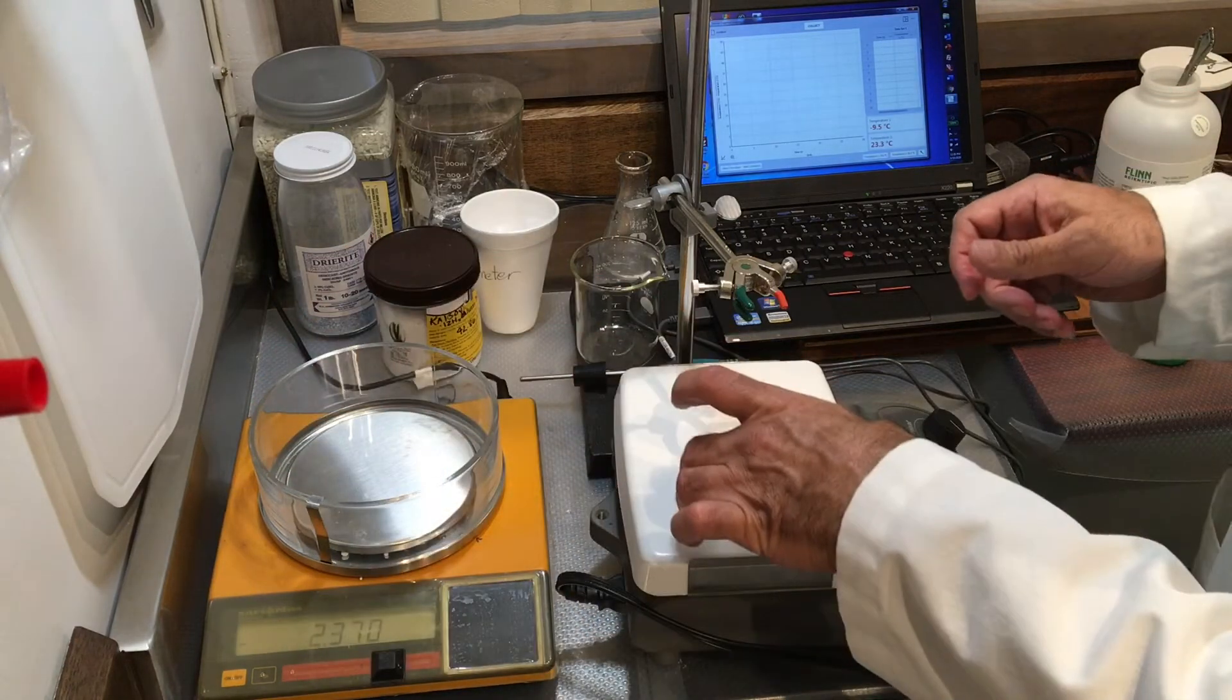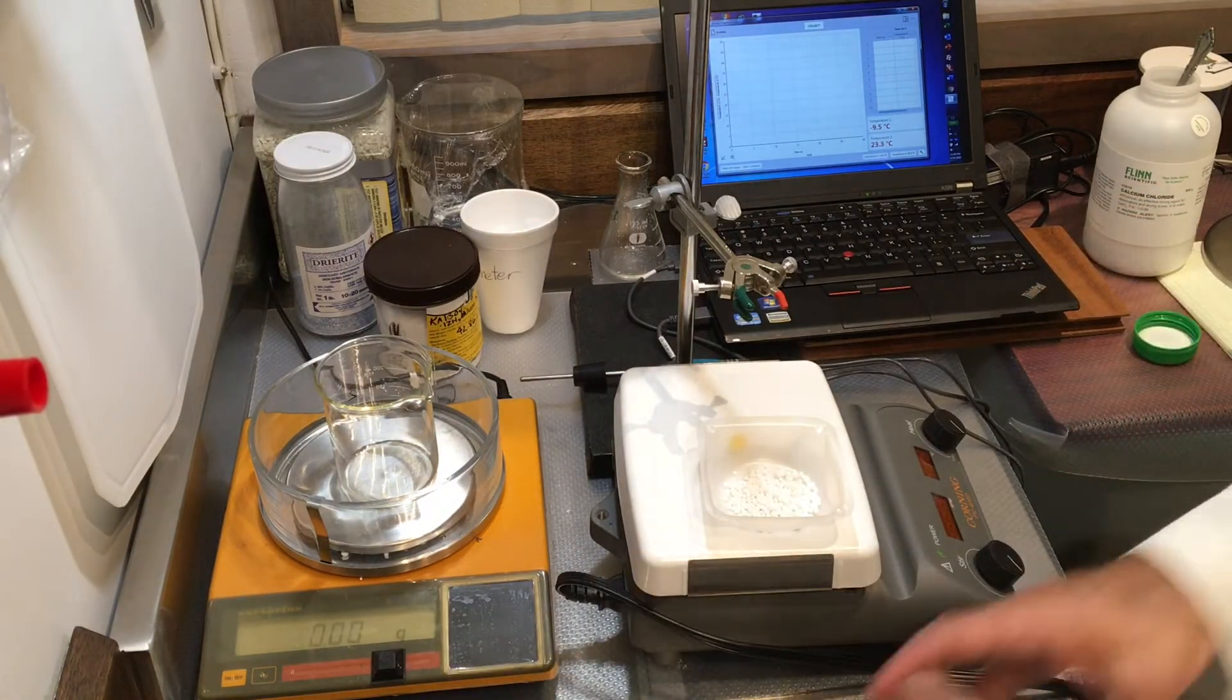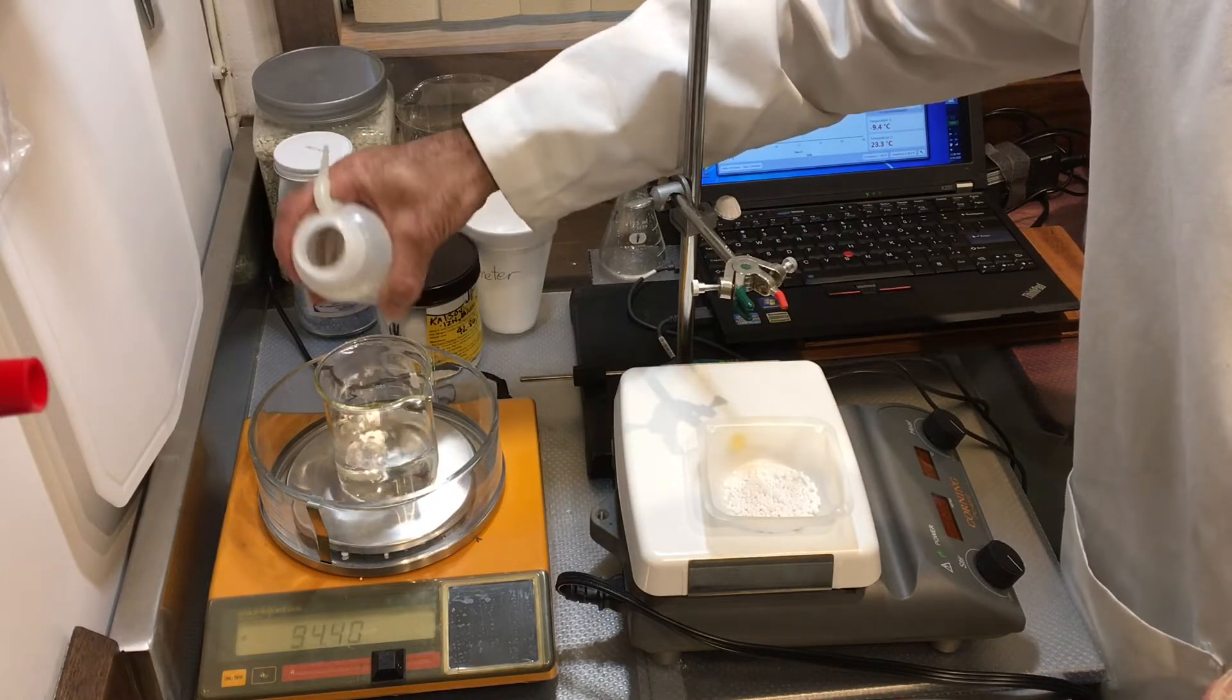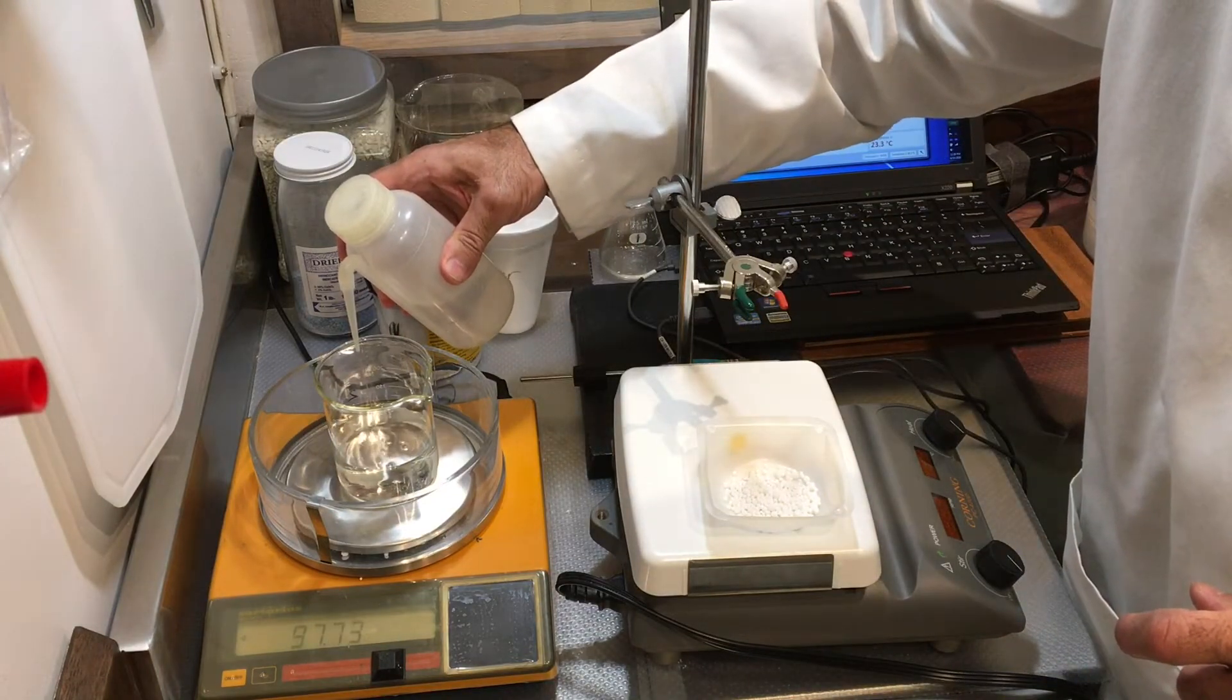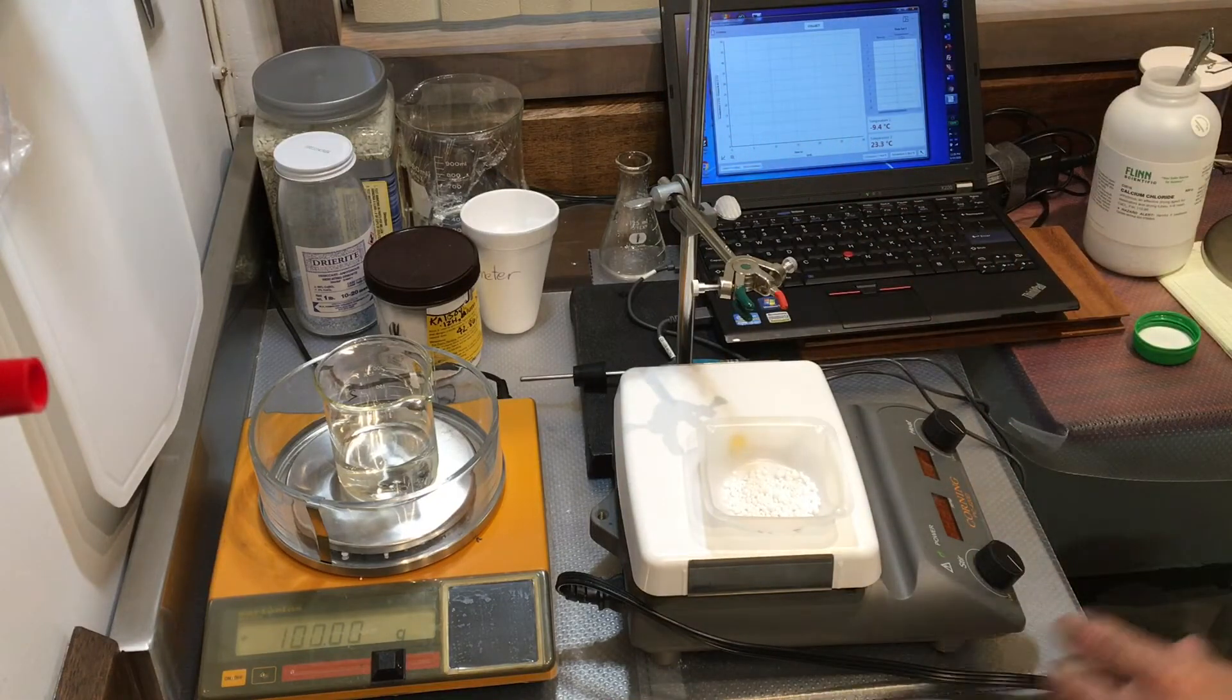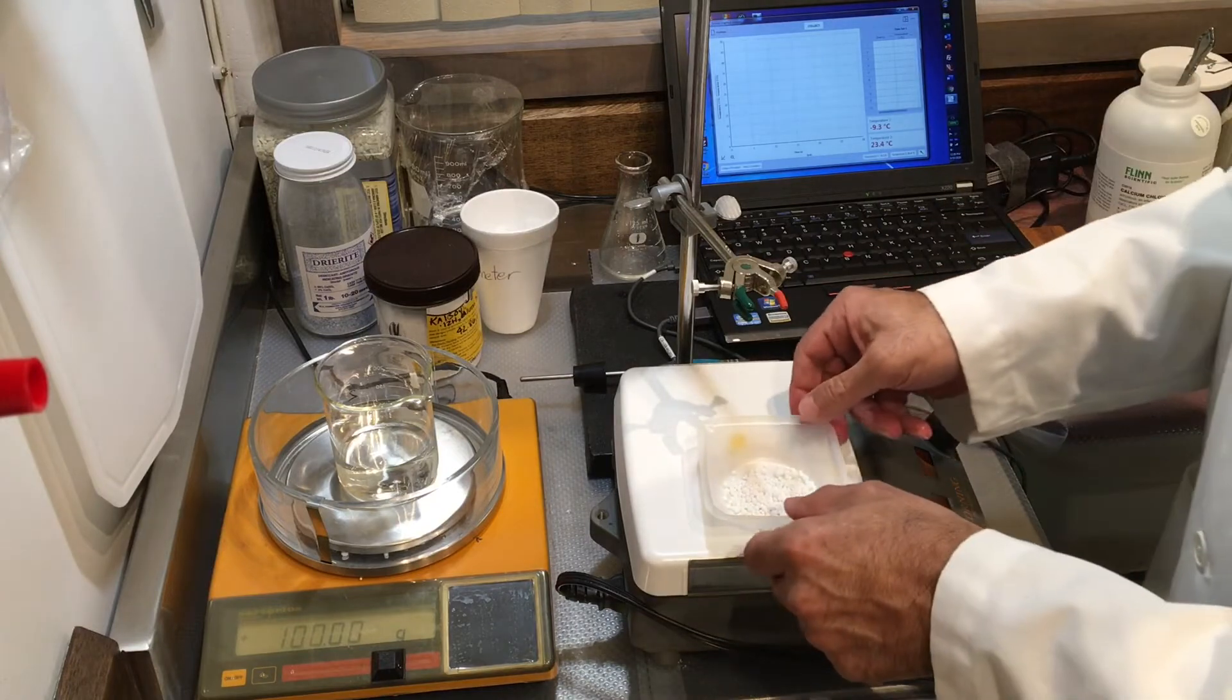We're going to transfer this mass, and let's go ahead and measure our water mass as well. I want this to be again close to 100, we'll see how close we get. Very close, like last time 100.00. I think I'm getting lucky every time to land it right at 100.00.